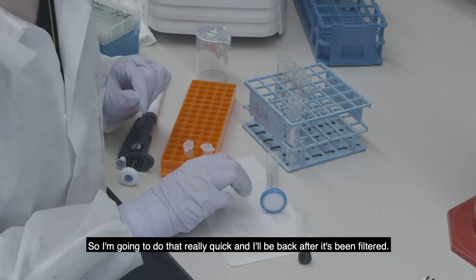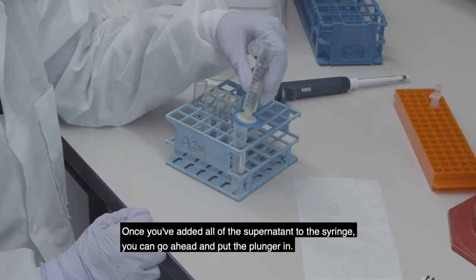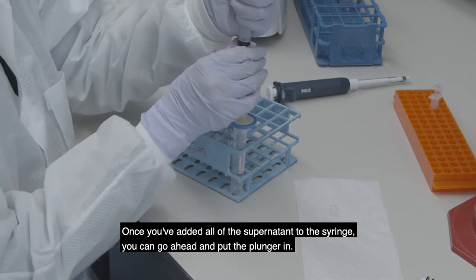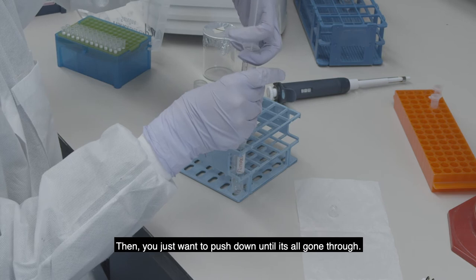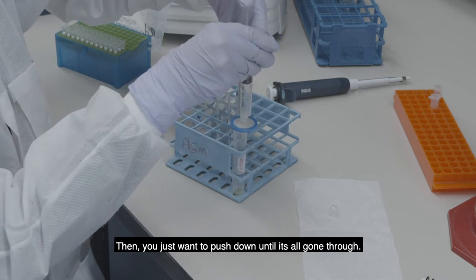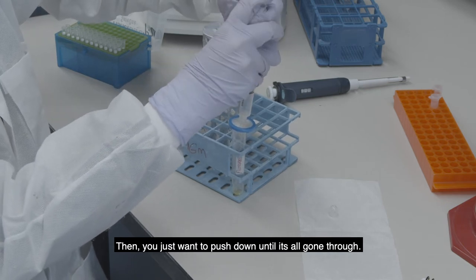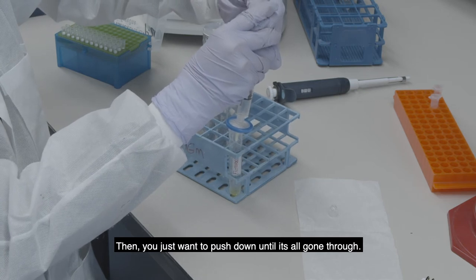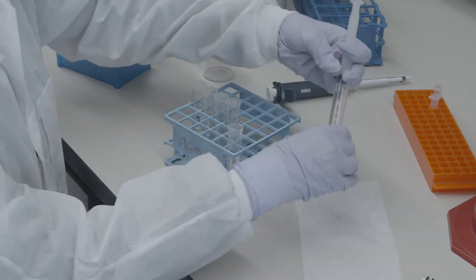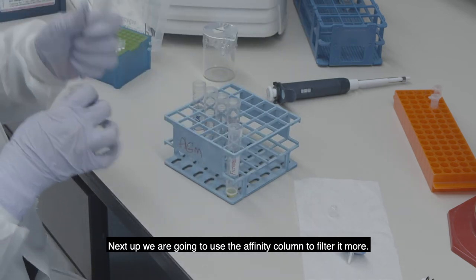Once you've added all of the supernatant to the syringe, go ahead and put the plunger in. Then just push down until it's all gone through. Next we're going to use the affinity column to filter it more.